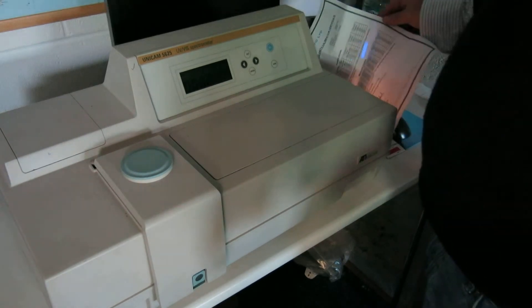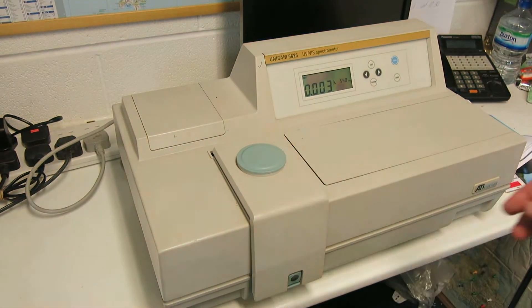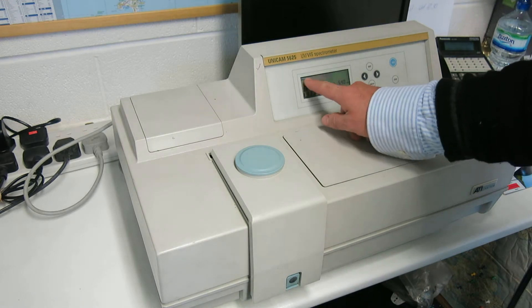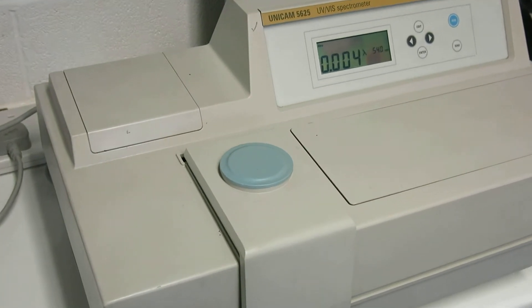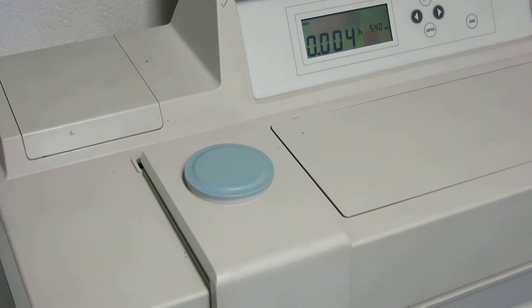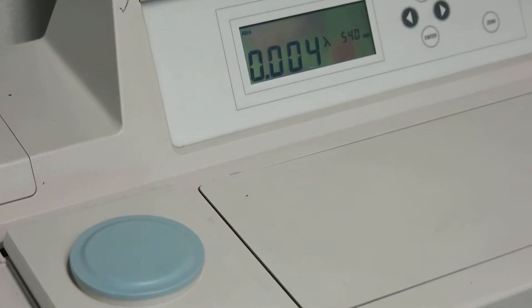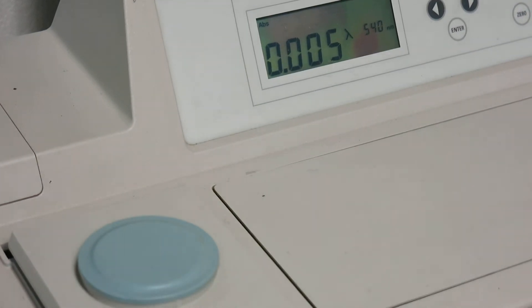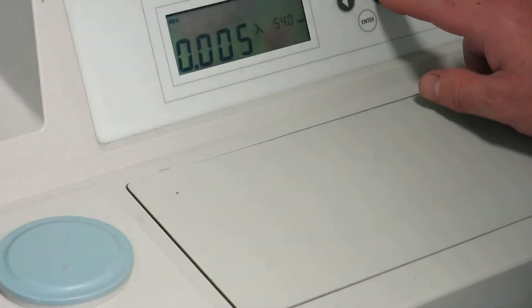Could you switch the light back on please? Thank you. What I'll do now is just flick through. So there's abs there — I'll just zoom in on that. Hopefully you can see that. I'll just flick through these here.